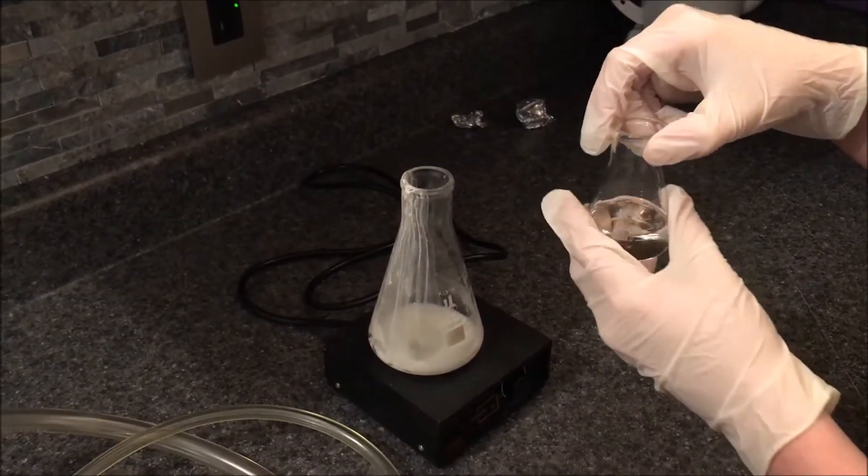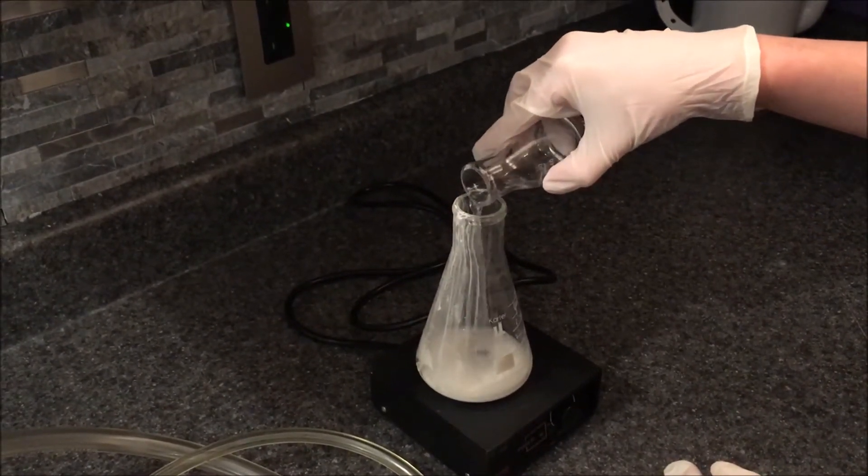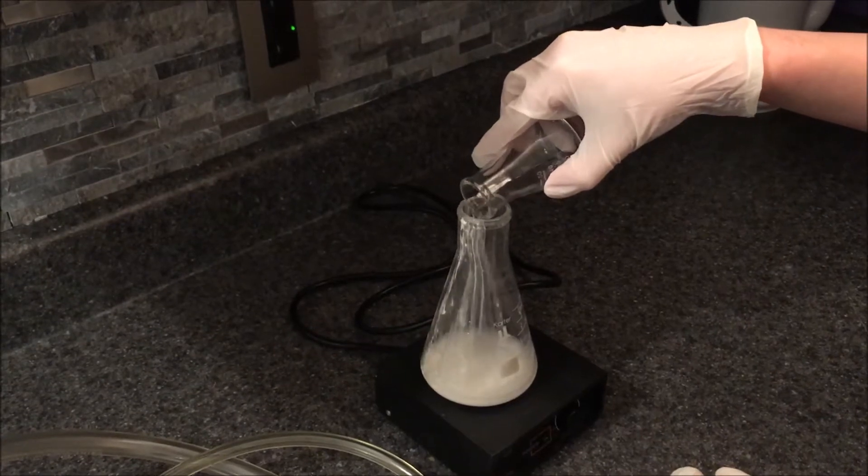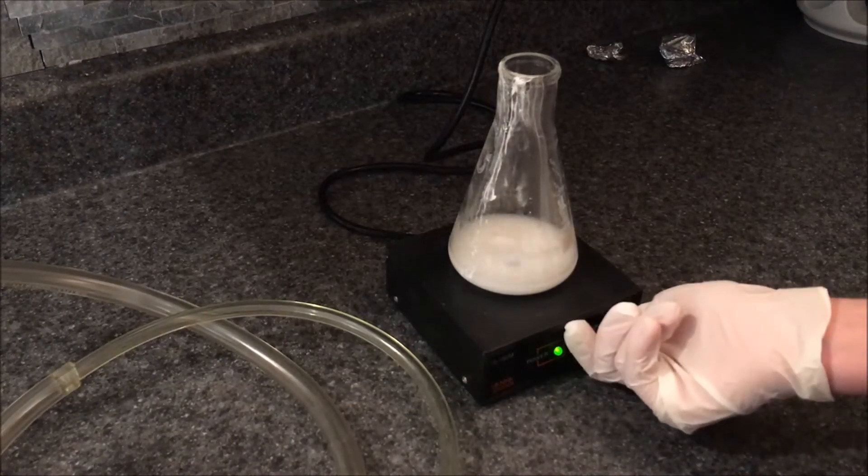Then add about 50 mils of dichloromethane or chloroform back into the crushed up pills. Stir it and then let it resettle.